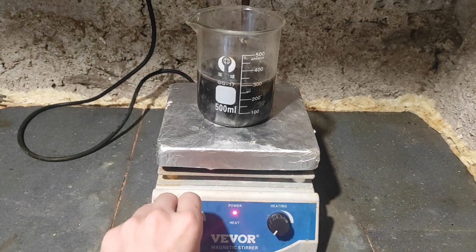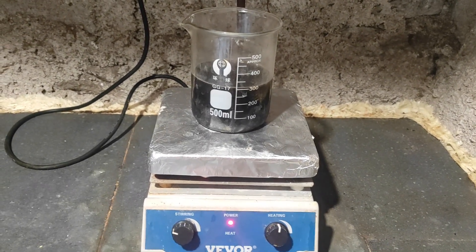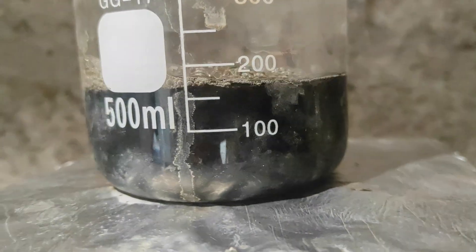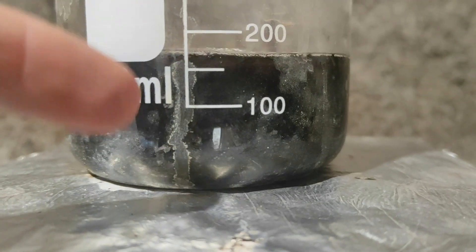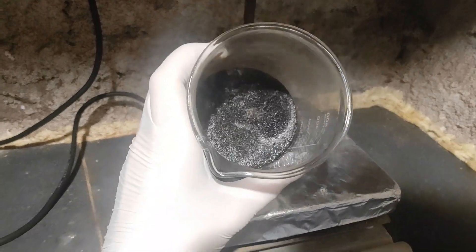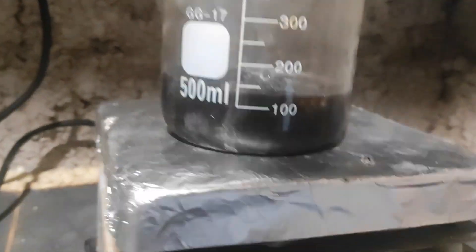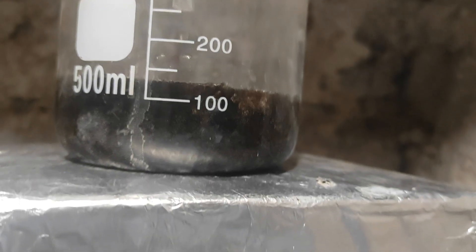Then I boil down the dark solution to recrystallize the para-toluene sulfonic acid. We should boil it down to at least 150ml — I'm going to aim between 100 and 150, about 125, just eyeballing it. After boiling down, we got some nice solid, but there's still a little bit of liquid, so we're going to be able to filter that very well. We're at more or less around 135ml, which is good.